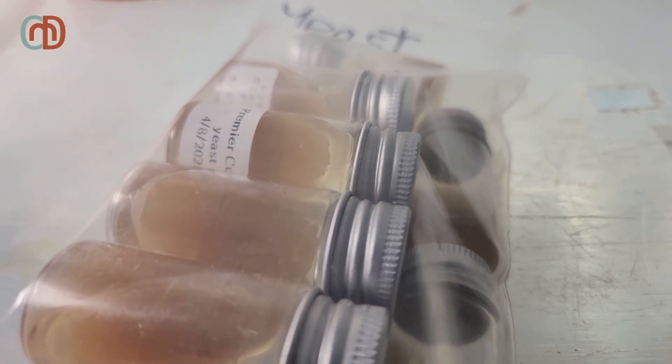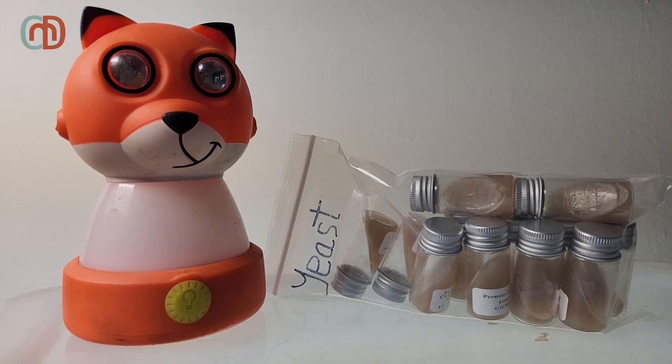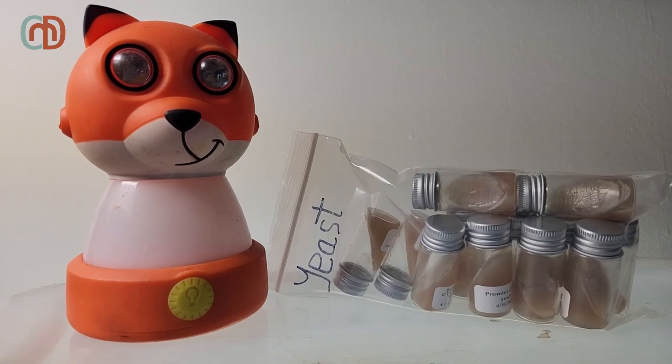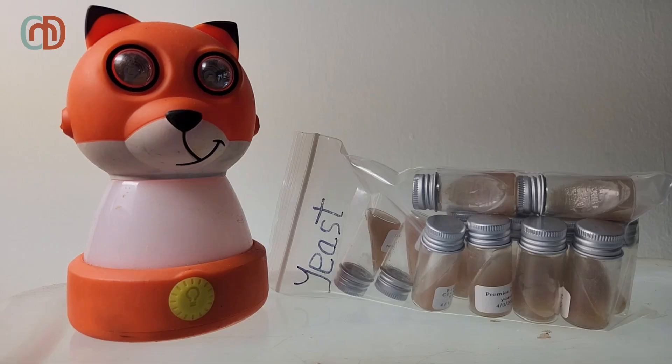Kept in the fridge, these cultures can last many years. The next episode will cover creating a yeast starter with it and starting a brew. The final episode will be post-processing and bottling your brew.